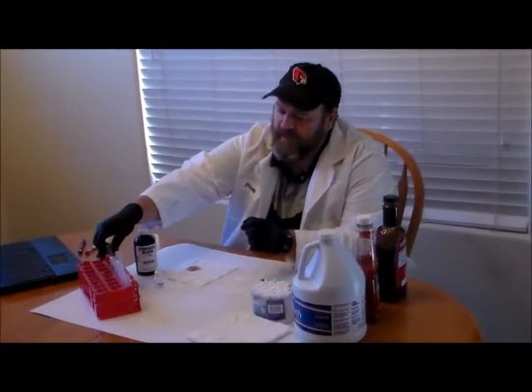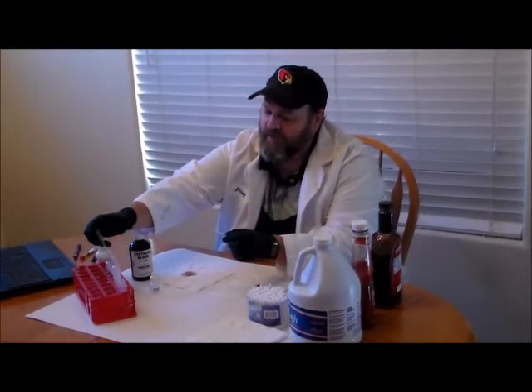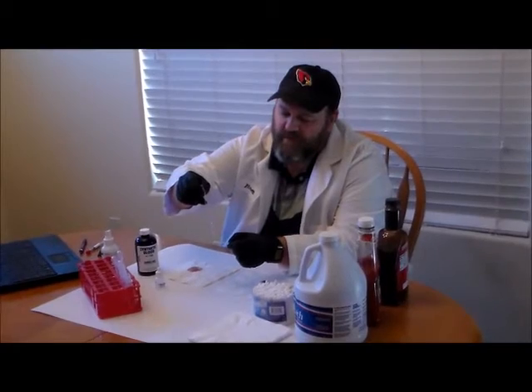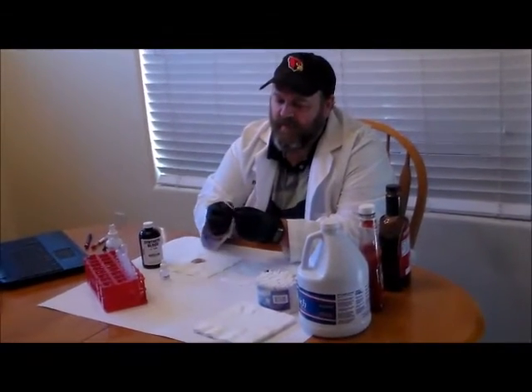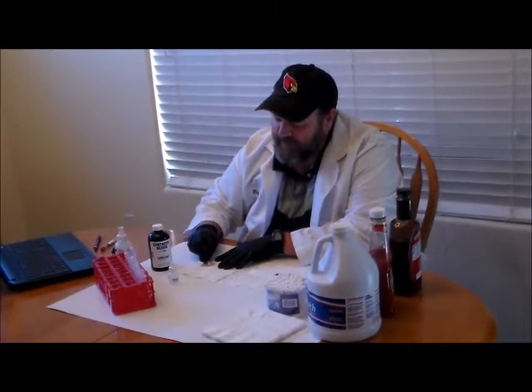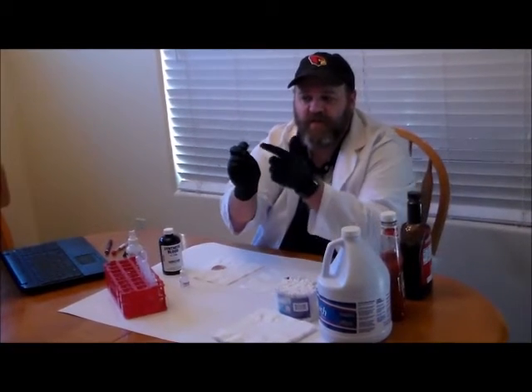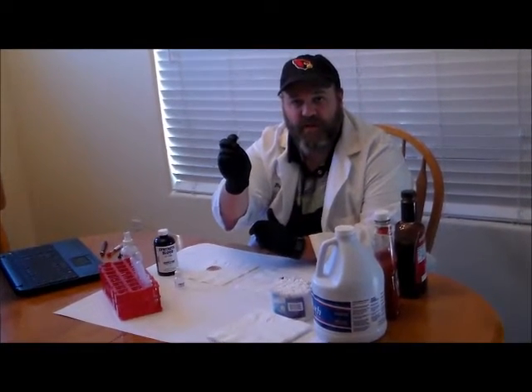So we're going to take our swab — our clean cotton swab — and we're going to put one or maybe two drops of water on the end of the swab, just to get it moist. Then I'm going to take my moistened swab and rub it against my stain. You'll notice that the end of the swab is discolored because some of the stain has been collected on the swab itself.